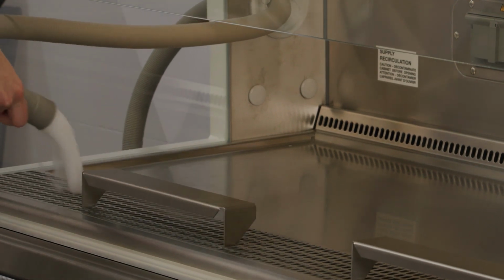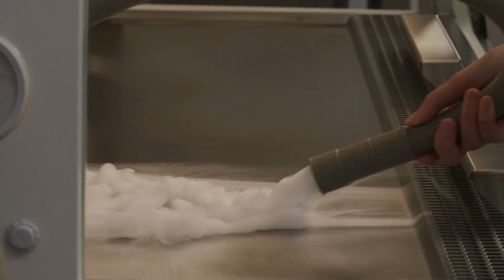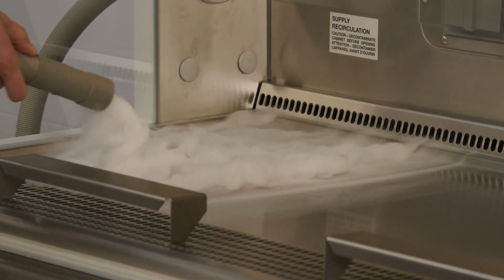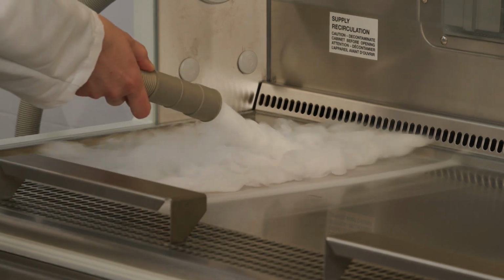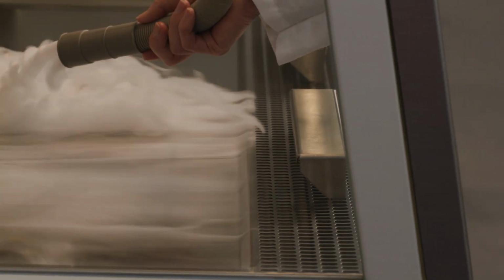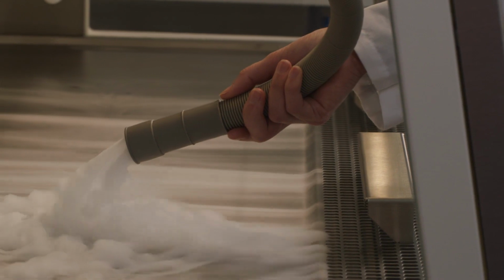So there's a third thing to look at. Go ahead and move it onto the work surface, say the center, from front to back, and notice how the smoke splits. We actually call it the split, but the smoke splits with about half the smoke going to the back grate and half the downflow going to the front grate. Now move it from left to right, and notice how the smoke continues that movement to front and back, but not so much right to left.